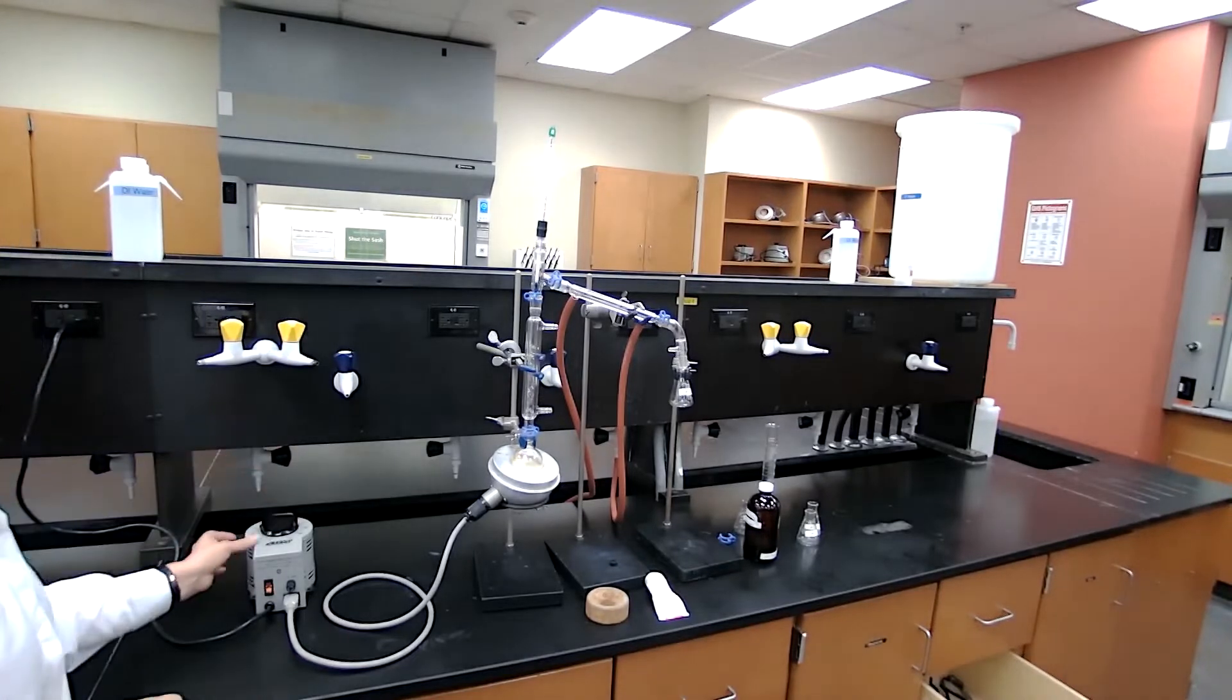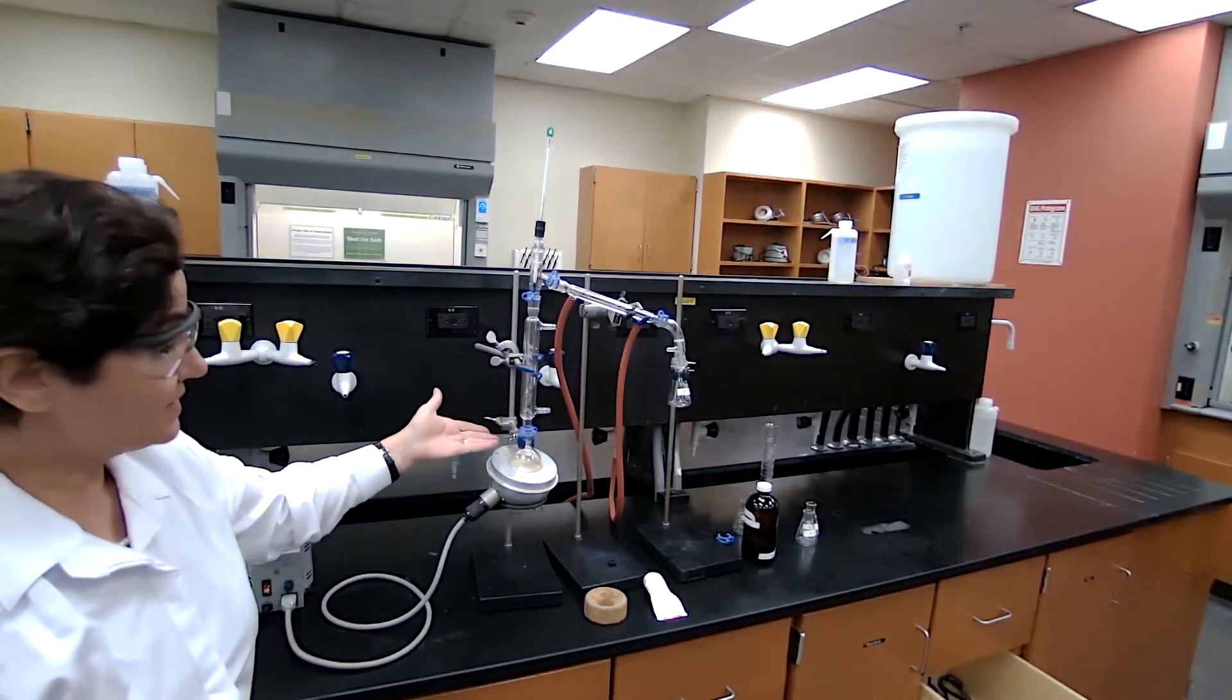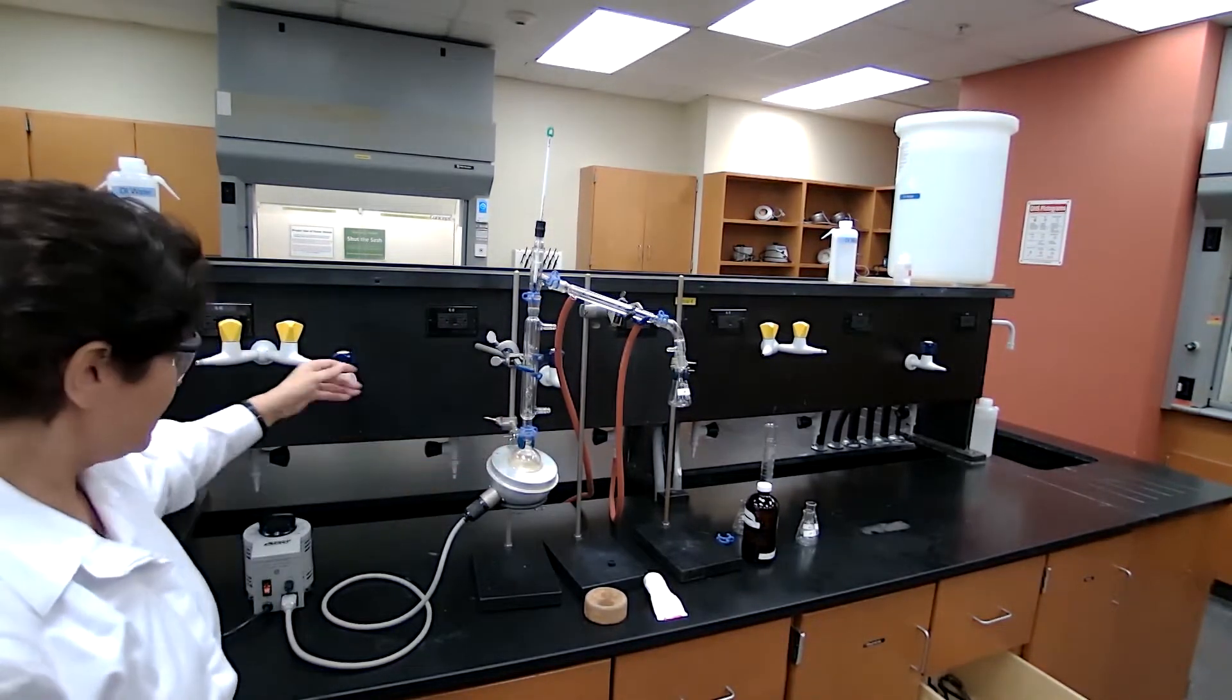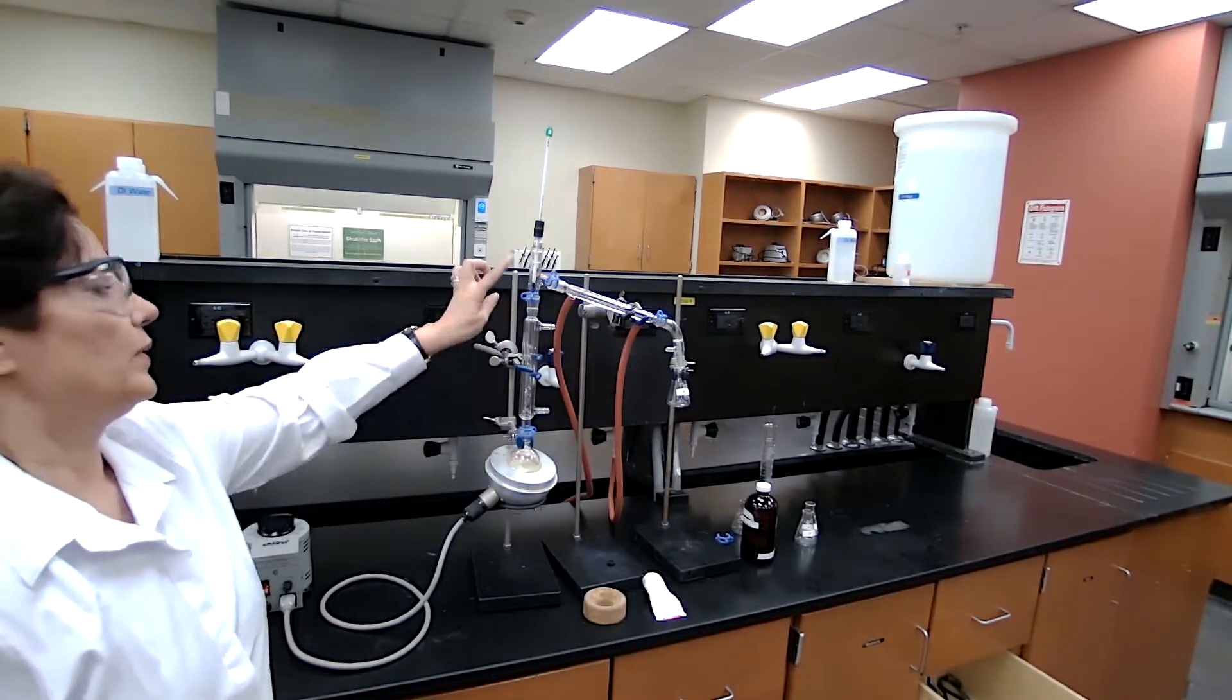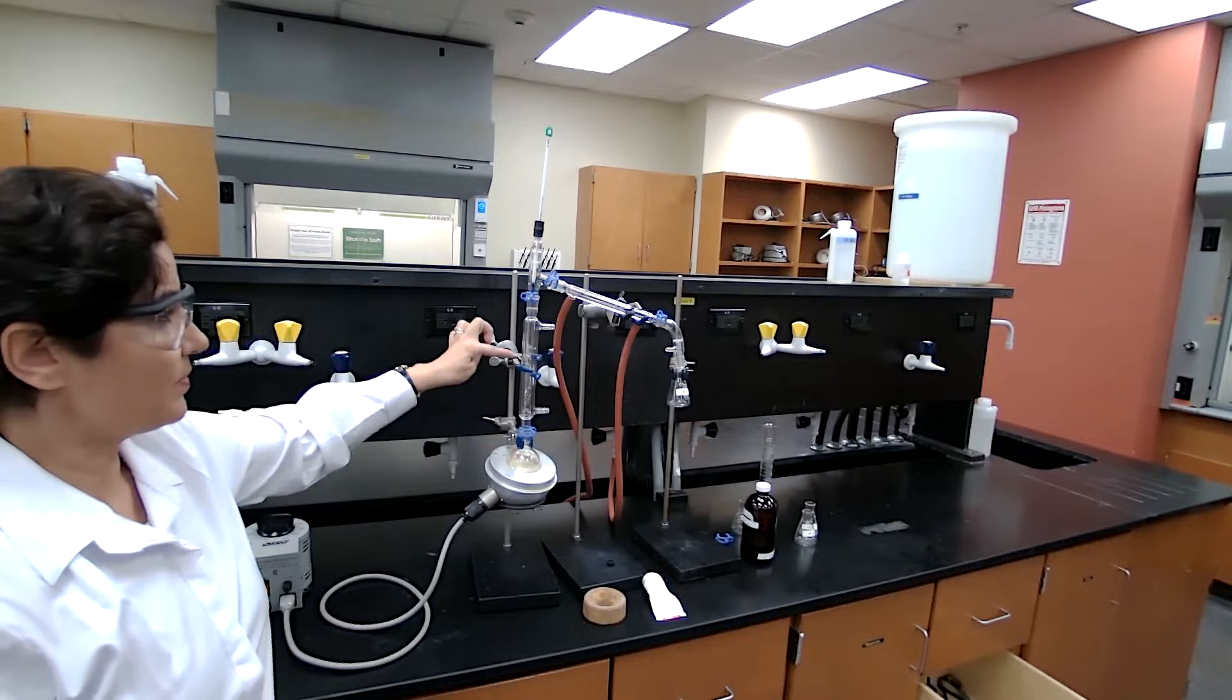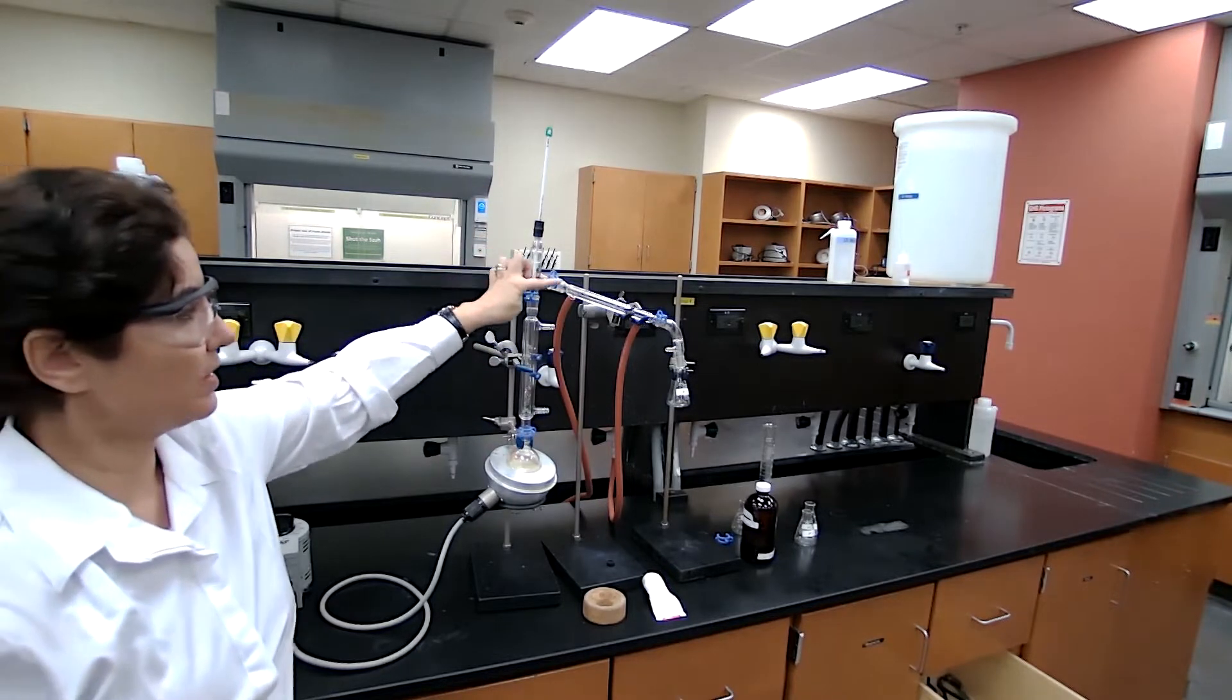We are going to start at 50. Wait for 5 to 10 minutes. If there is no boiling taking place, we are going to increase it. If there is boiling, we will wait until the vapor makes their way to the condenser.